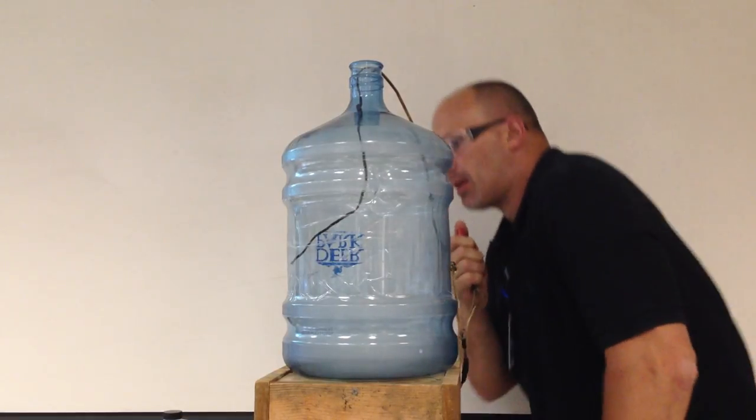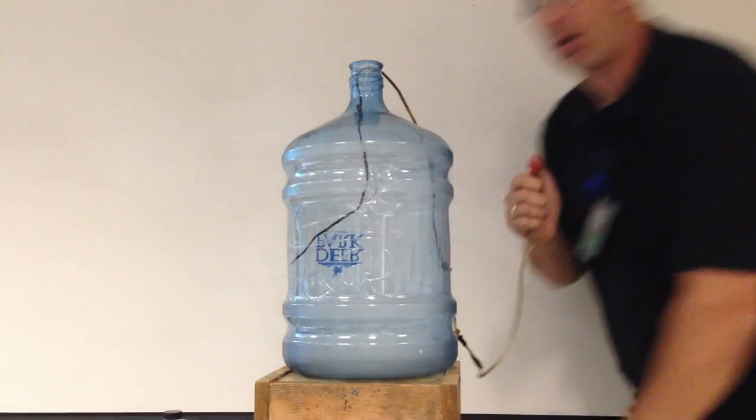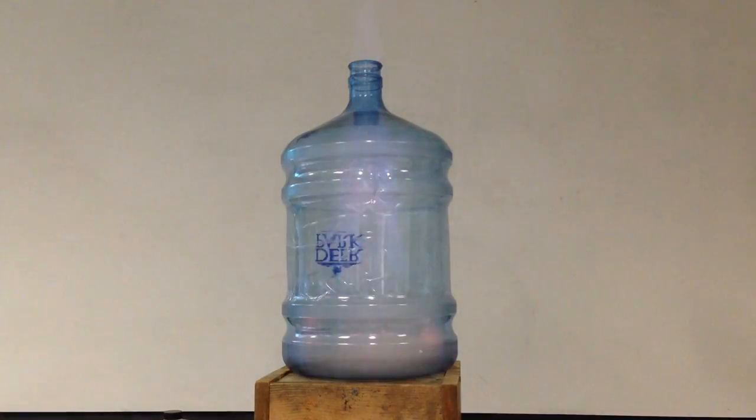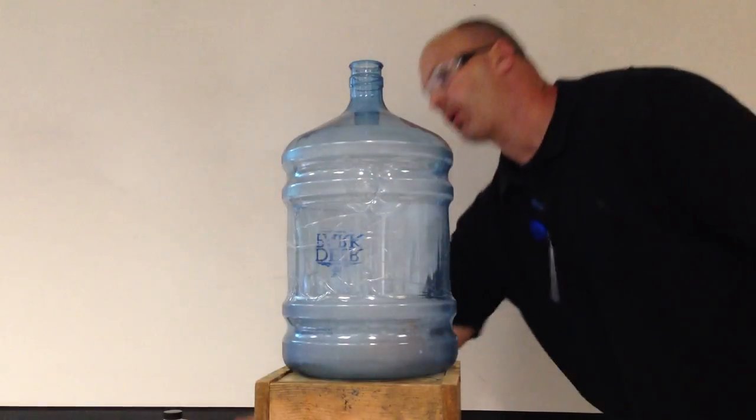I'm going to step off to the side. I'm going to light this. And I have an extra part to this. So, here we go. One, two, three. And I'm going to quickly cover it.